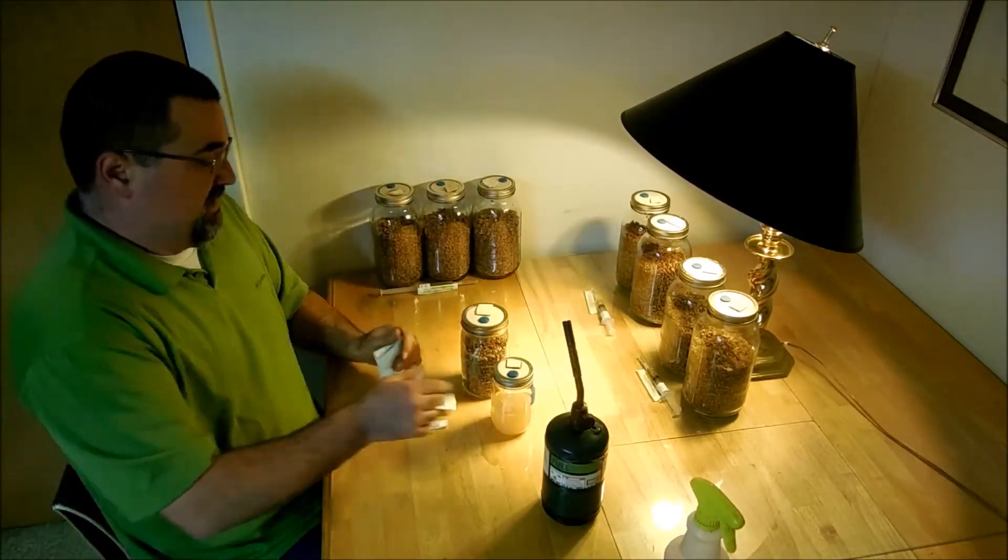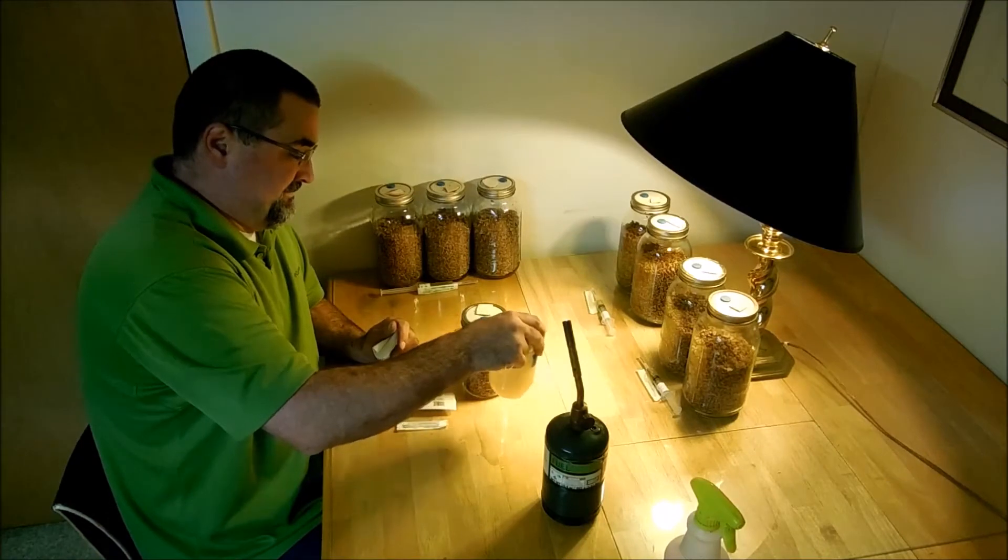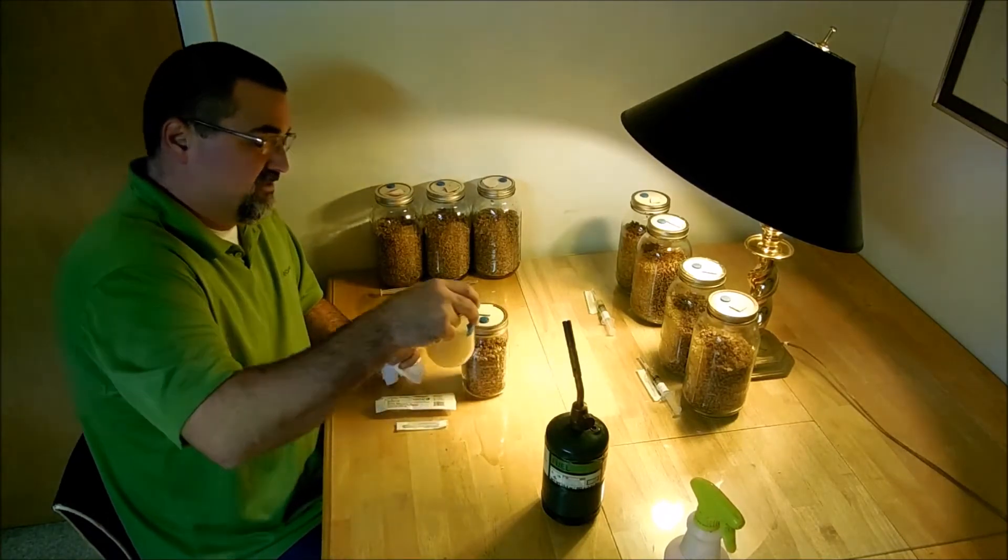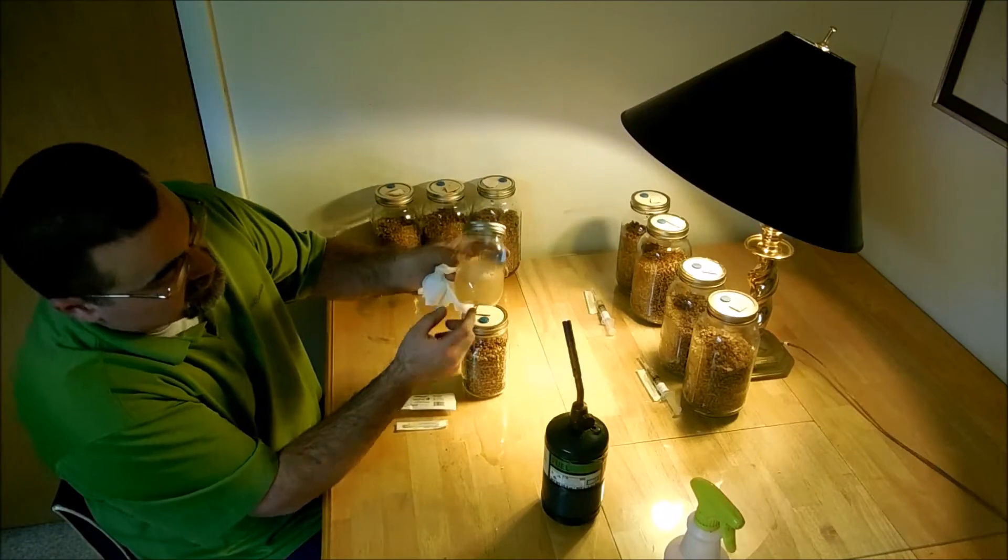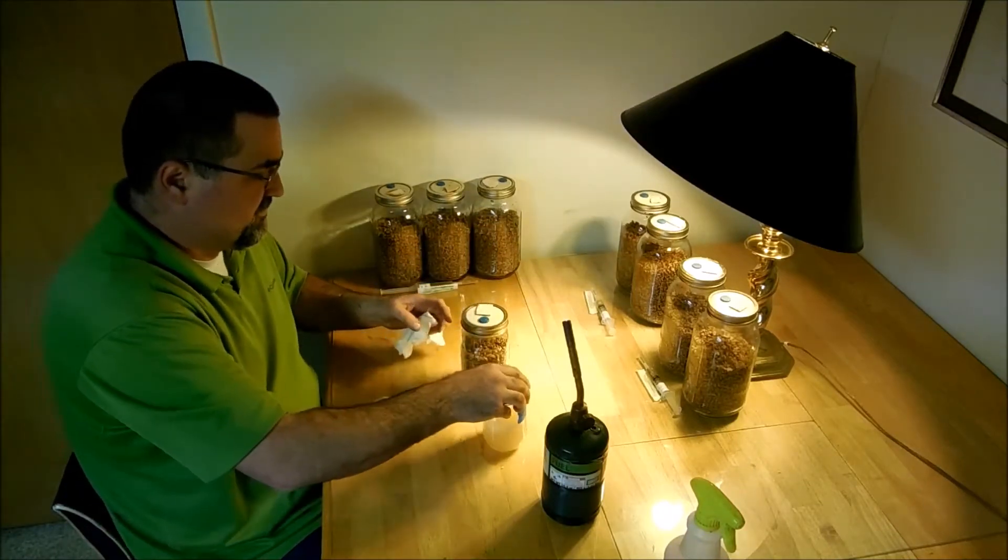So we have the liquid culture here. Stir that up real good. One little trick I like to do is I have these little glass beads I put in the bottom to help stir that up.